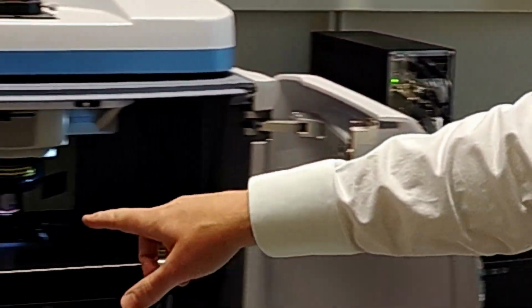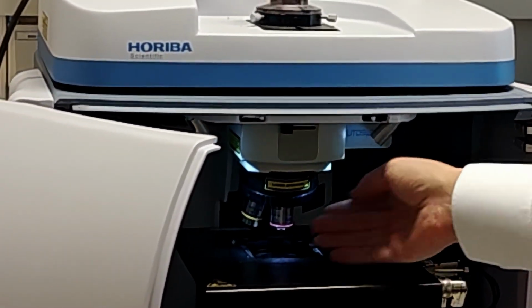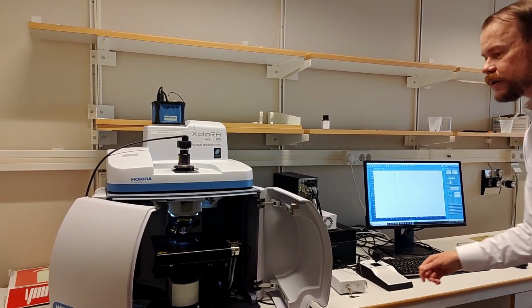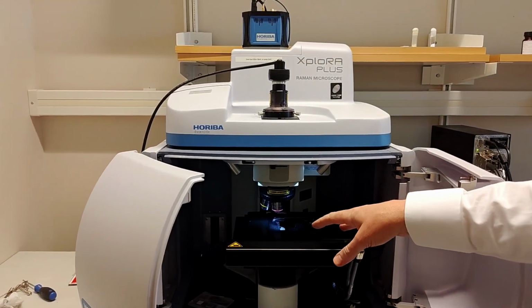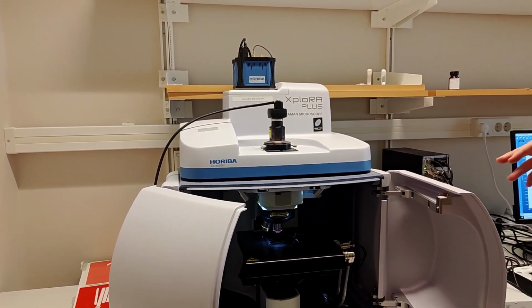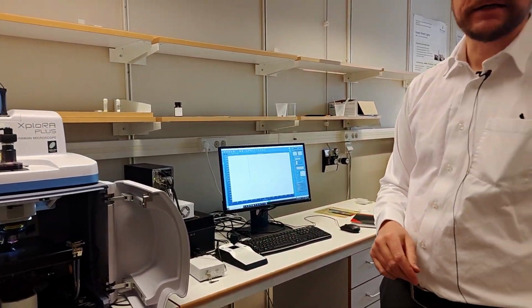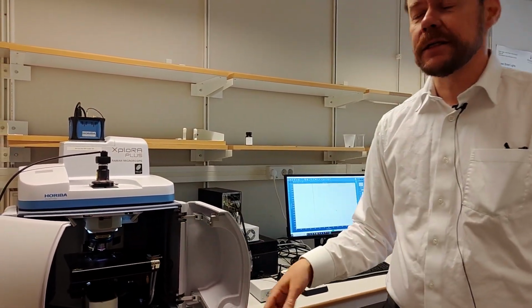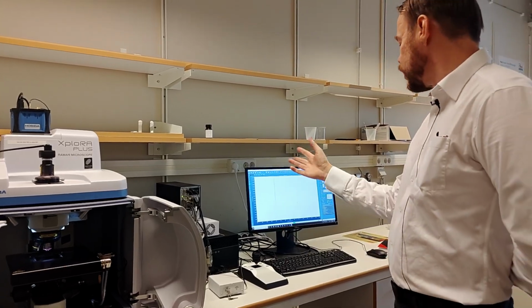And when we click OK here, it will start to do that. Before you do that, you need to check that the objectives here have some free space, so you don't crash into the objectives. So when I click OK here, it will start to move around to calibrate it. And if the machine does this and finishes, then you know that the electronics connection to the computer is all working fine. If you don't see these messages, or if this jams or something, then there is a connection error. So now everything is fine.